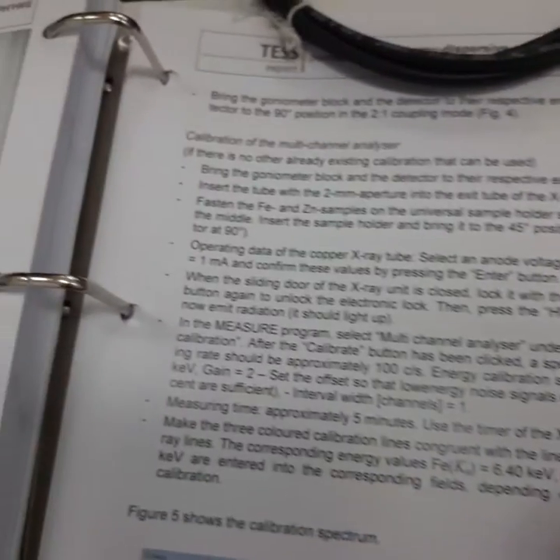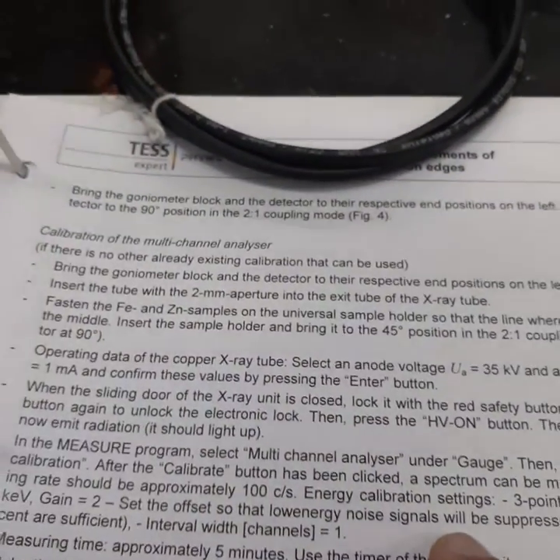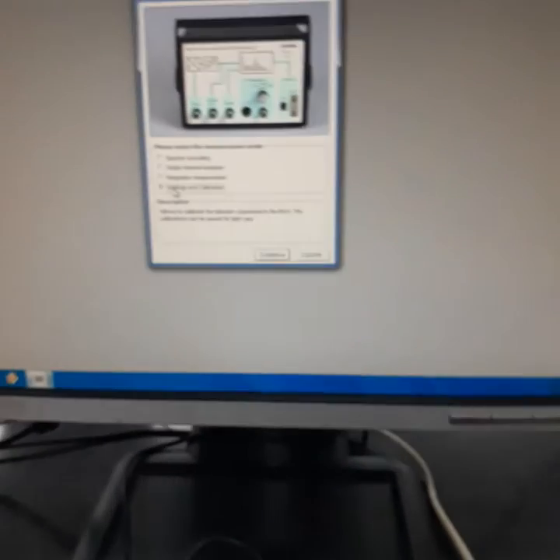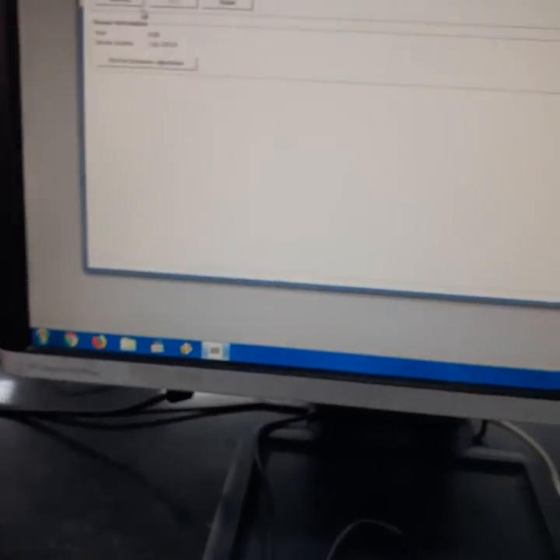Then according to the instruction in the manual, we have to use the multi-channel analyzer under gauge. In the software here, we will use the multi-channel analyzer under gauge. Now we have this nice screen here. We will check the settings and calibration. Calibration is here. Then we will continue on. I think I heard a sound from the multi-channel analyzer now. There is a connection between the PC and the multi-channel analyzer. We will make a calibration.